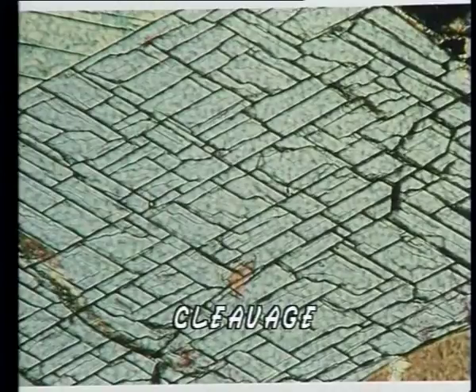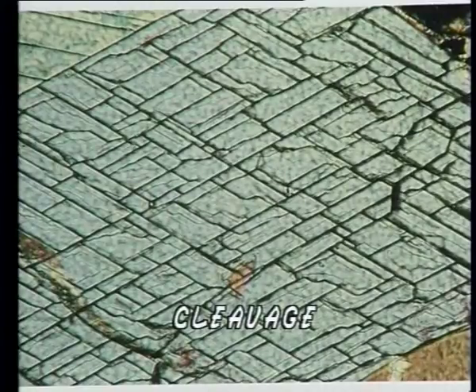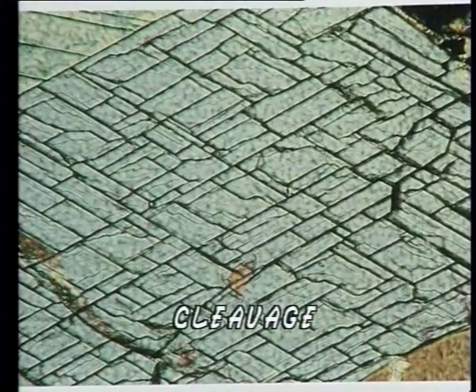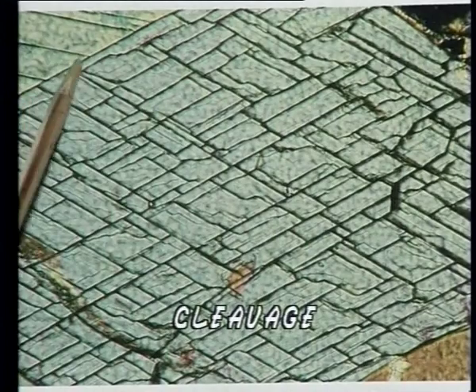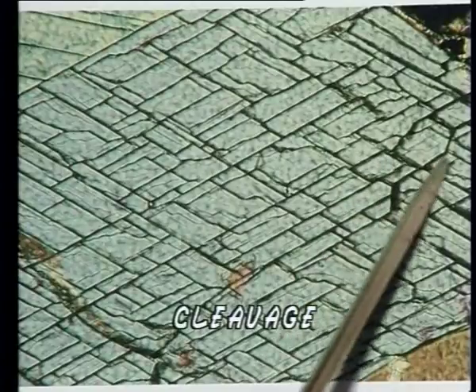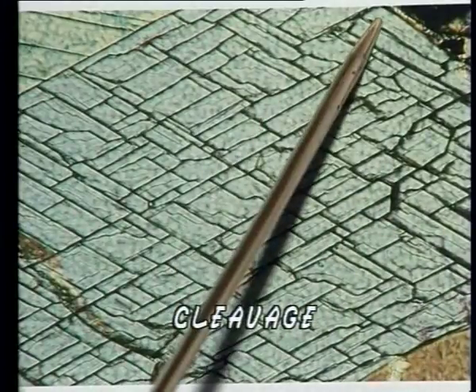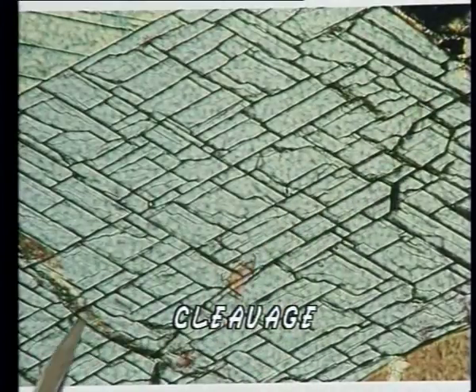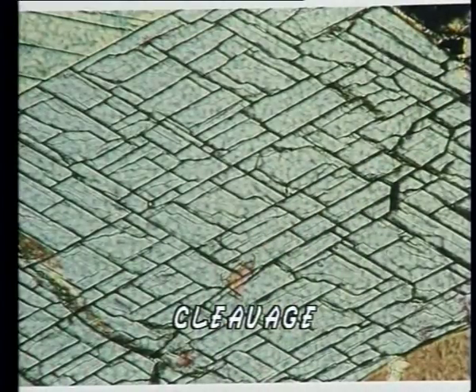In thin section, cleavage of a mineral is seen in the form of a parallel set of dark lines confined to a mineral grain. Micas like biotite and muscovite are characterized by one set of perfect cleavages. Amphibole group of minerals show two sets of cleavages intersecting at about 120 degrees. We will now observe the minerals after inserting the analyzer — that is, the upper polarizer — in the optical path.